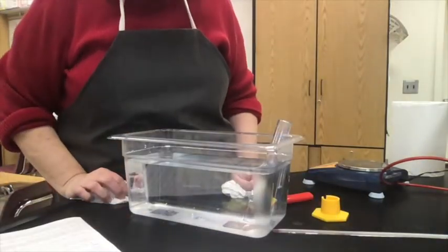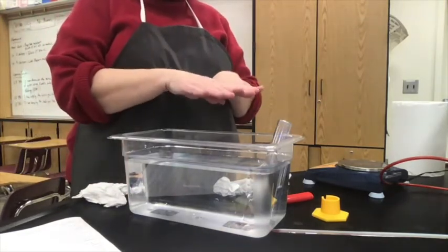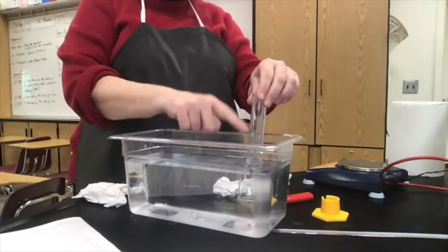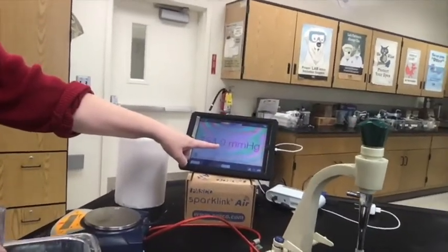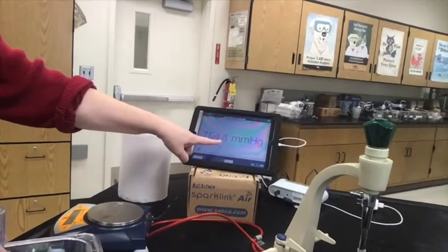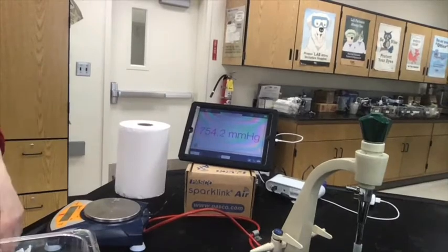Now step number 8 says record the barometric pressure. Remember, the barometric pressure, because they were equal when I read the volume, is going to be the pressure of the gaseous mixture in here. And we look on our handy dandy barometer over there. I think this is super cool because you can see how it's bouncing around because gas particles from the air are hitting the barometer. But we just pick the one that we see the most often, which I would say is 754.0.